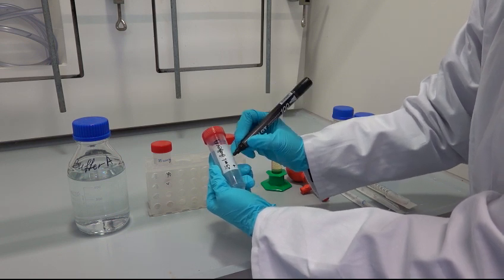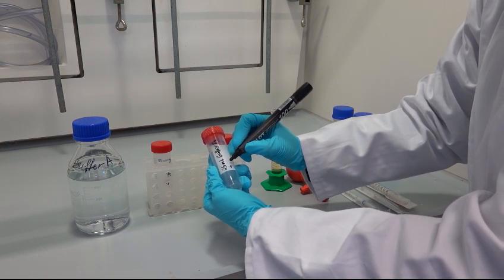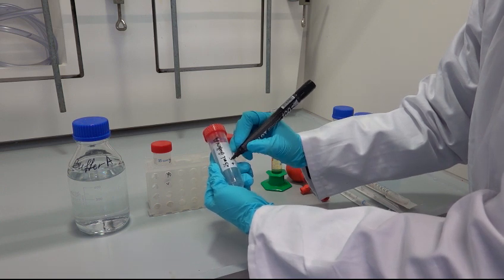First, label the tubes with the date, content, and the number of the sample to not get confused.